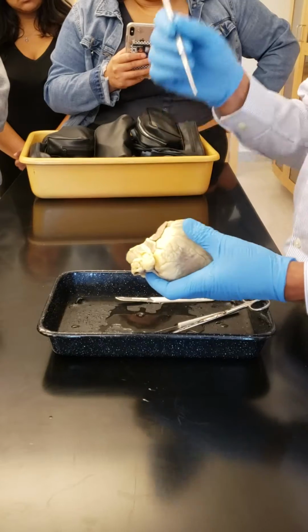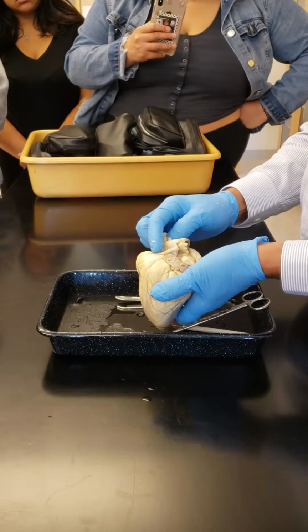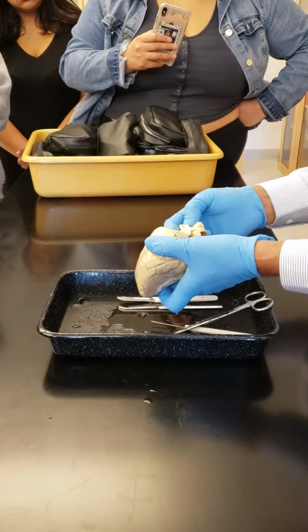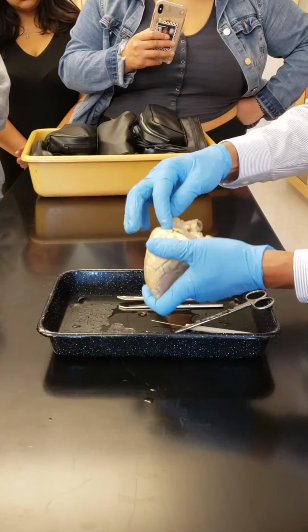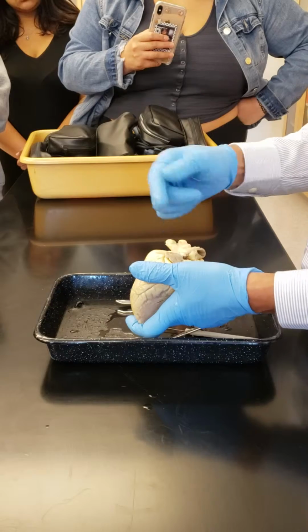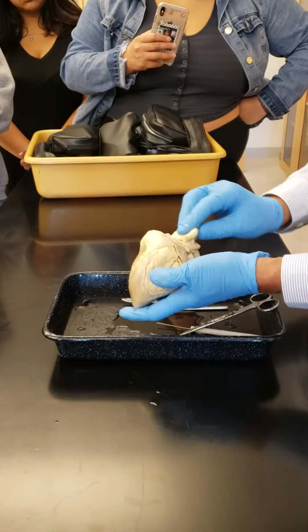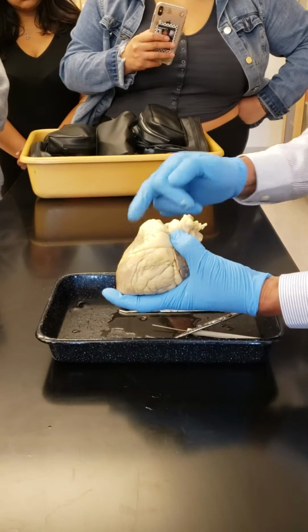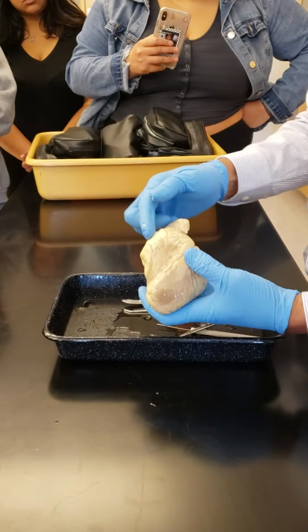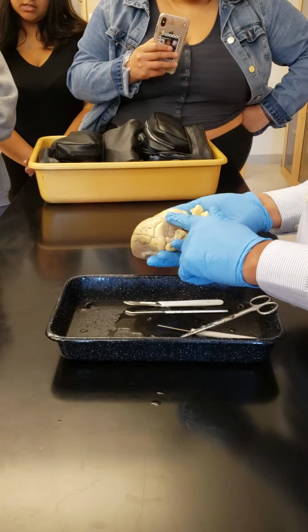And you know that where the pulmonary trunk starts, there's a pulmonary valve, which has 3 pockets. Similarly, where the aorta starts, from the ventricle, there are 3 pockets, valves. We call it the aortic semilunar valve. Which valve is between this atrium and this ventricle? The tricuspid valve on the right side. On the left side? Bicuspid.